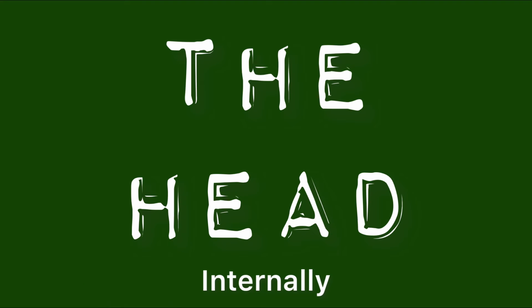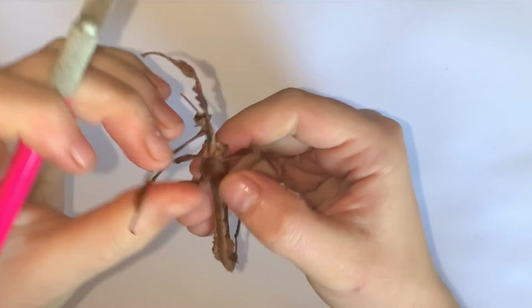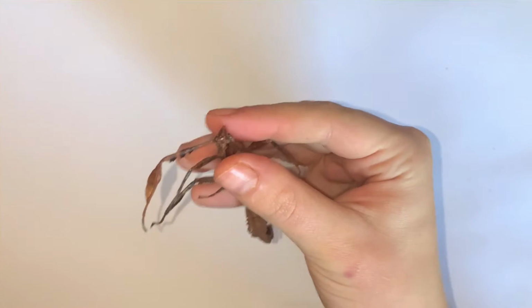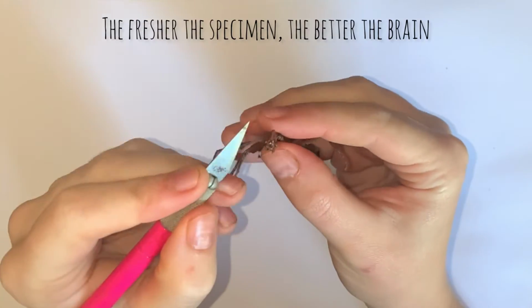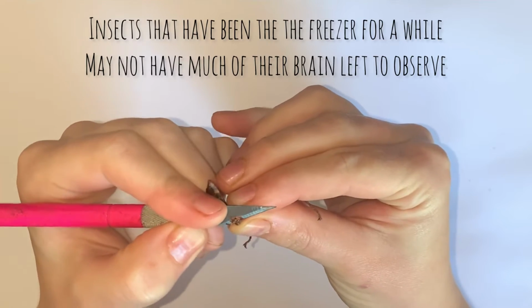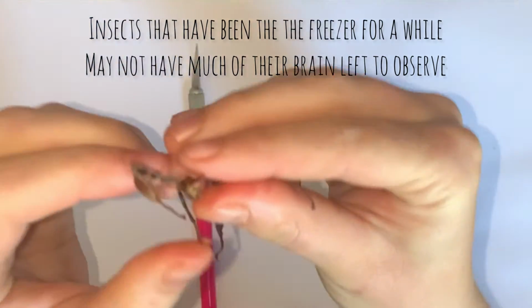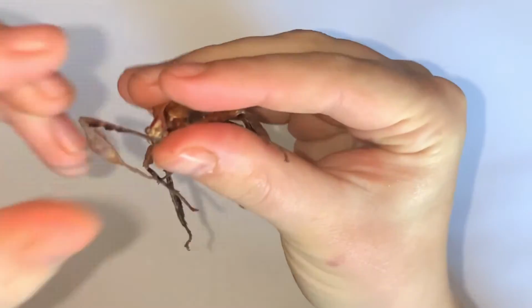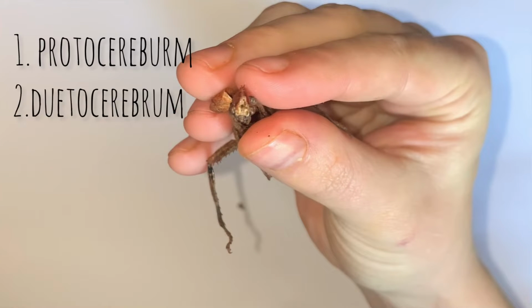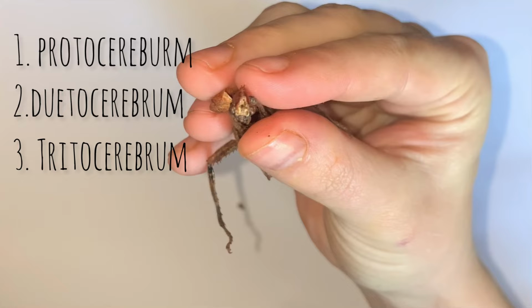Now let's get into further detail, starting with the head. To view the stick insect's brain, one must carefully cut open the exoskeleton where the simple eyes and antennae sit. The stick insect's brain consists of 3 lobes: the protocerebrum, the deutocerebrum, and the tritocerebrum.